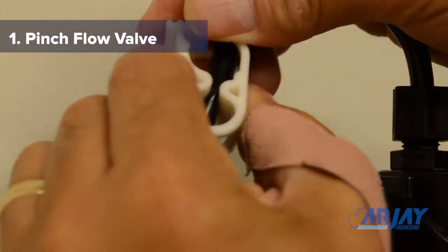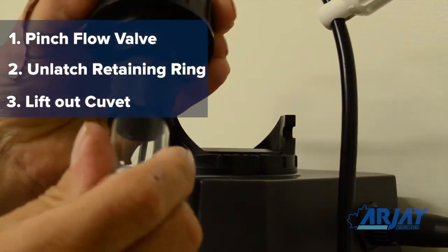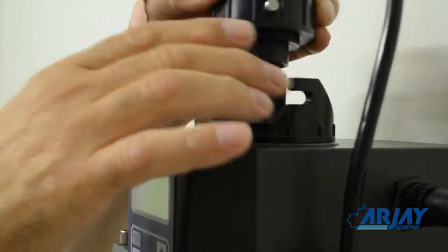Simply pinch off the flow valve, unlatch the retaining ring, and lift out the cuvette. If the glass requires cleaning, the cuvette can be removed and cleaned remotely. When done, replace the cuvette, latch the retaining ring, and allow flow again.